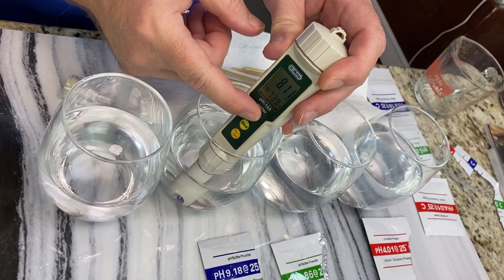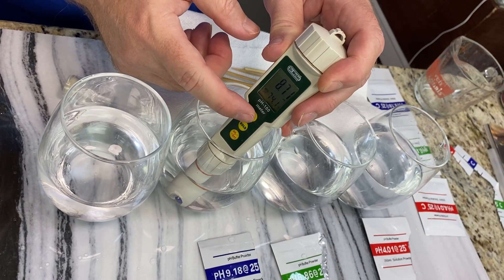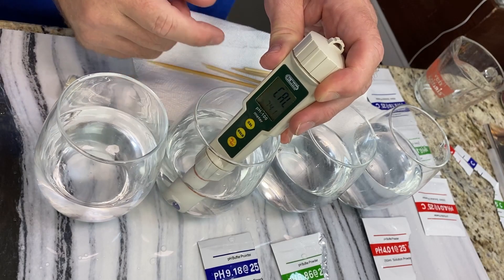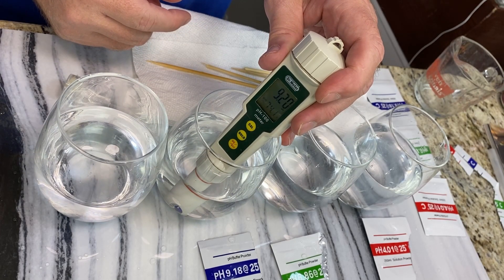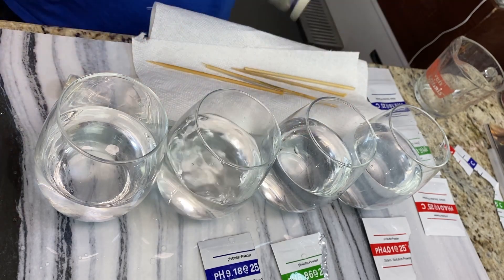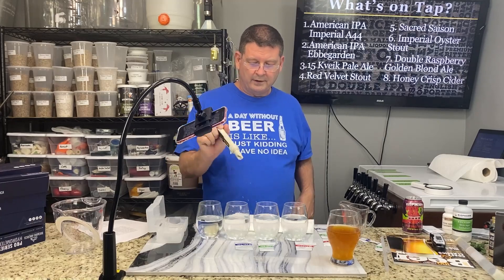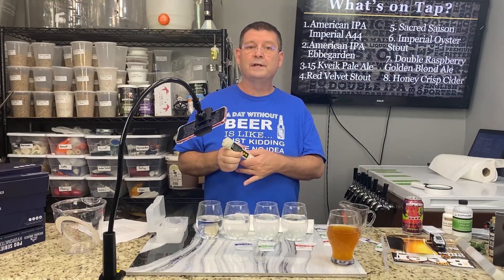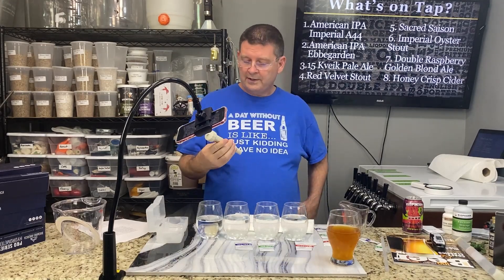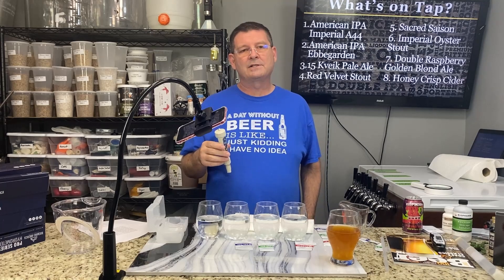Now that it's calibrated, we can use it. I'll put links below for all the packets you're going to need — just buy some spare packets, trust me, you'll need them. At 30 bucks, if you want science lab research quality, go ahead and drop a couple hundred or even a thousand dollars for something that supposedly never needs calibrating. Though I've seen some medical ones that are much more expensive and still need calibration a couple of times a day, which is kind of scary.